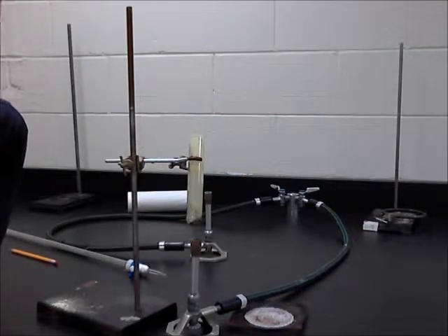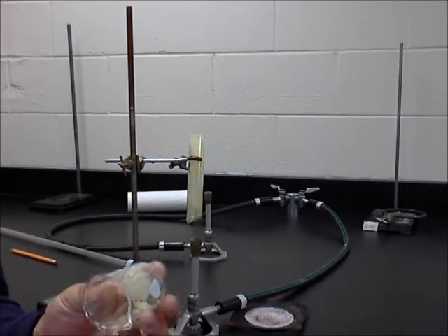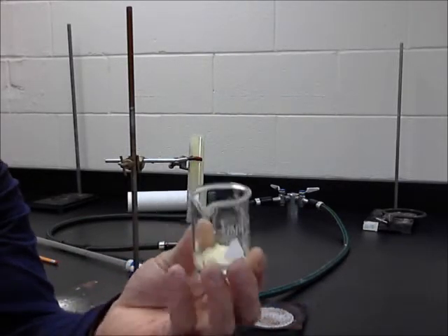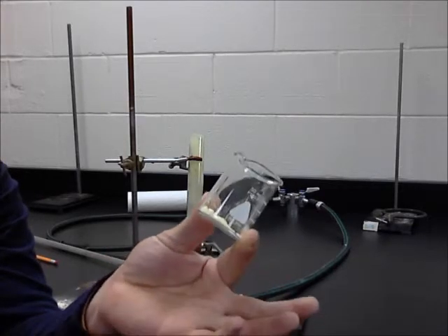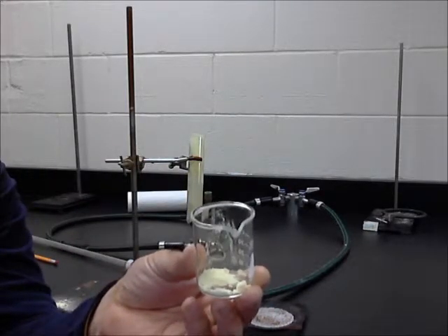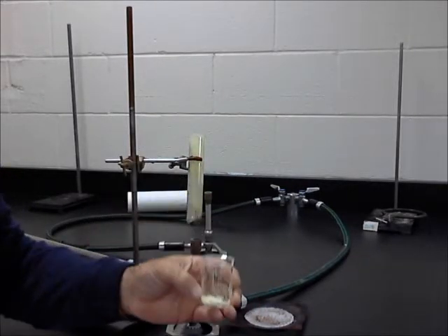Number 3 says observe the copper and sulfur and note some of their physical properties in the data tables. You should create your data table, and you'll notice that sulfur here is yellow. It's powdery. It moves around pretty well. It's got most of the properties of non-metals. Smell-wise, sulfur has a little bit of that match-burning smell, but we have to wait to actually burn it to get that good smell.